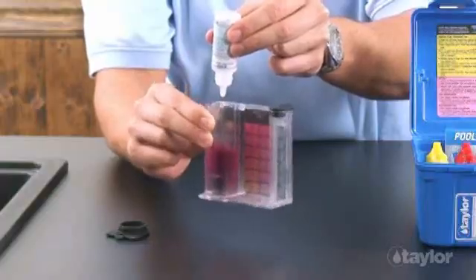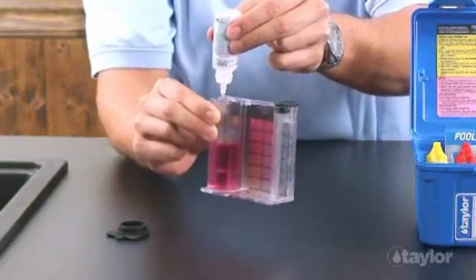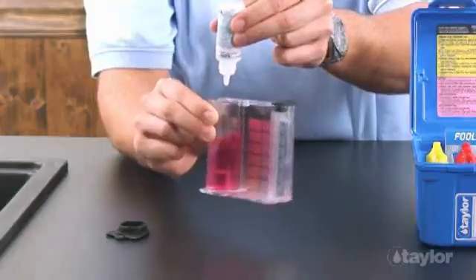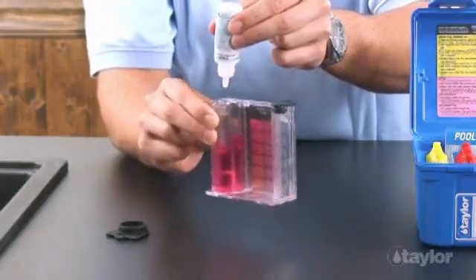Add one more drop of titrant after the endpoint to be certain the color change is permanent. If the color remains unchanged, do not count this drop.